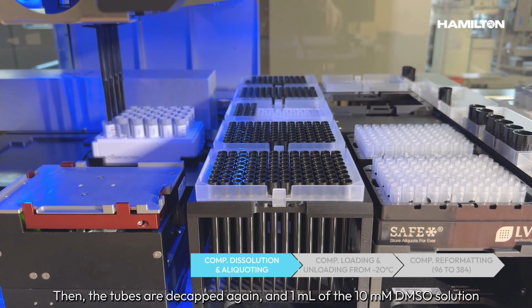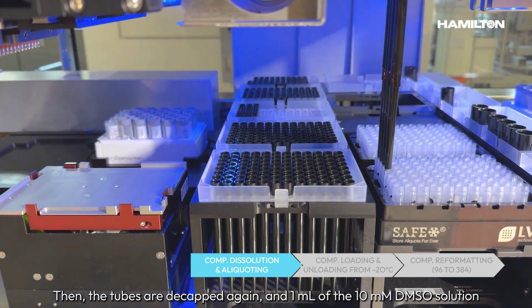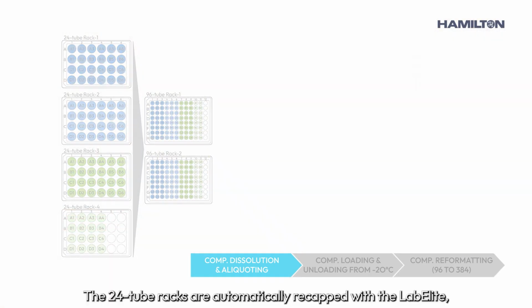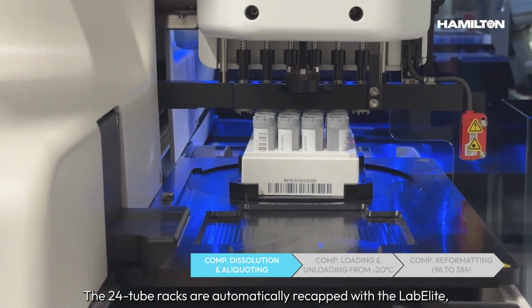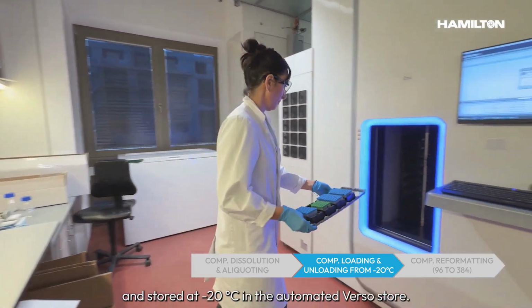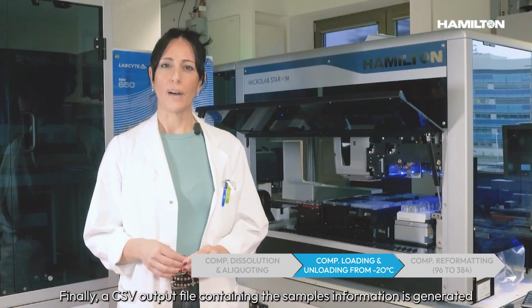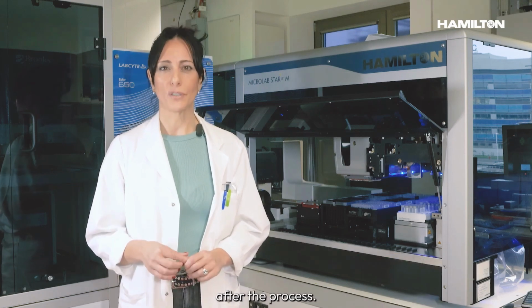Then, the tubes are decapped again, and 1 milliliter of the 10 millimolar DMSO solution is transferred into 2 identical 96 tube racks. The 24 tube racks are automatically recapped with the Lab Elite, and the 96 tube racks are manually recapped and stored at minus 20 degrees in the automated Verso store. Finally, a CSV output file containing the sample's information is generated after the process.